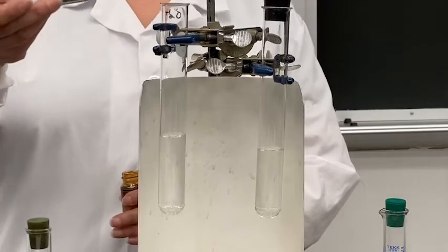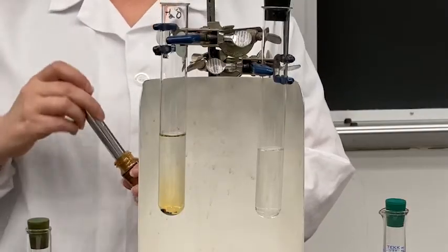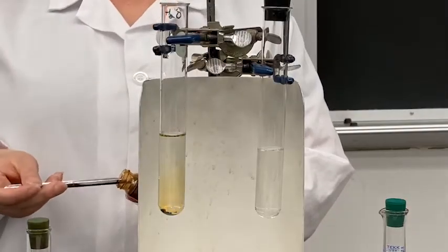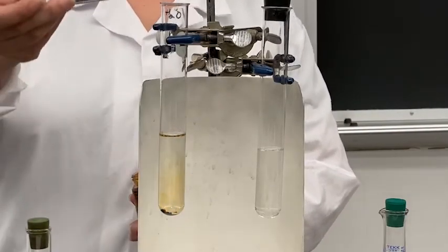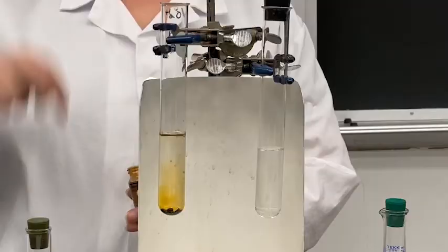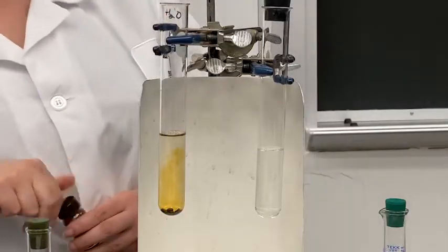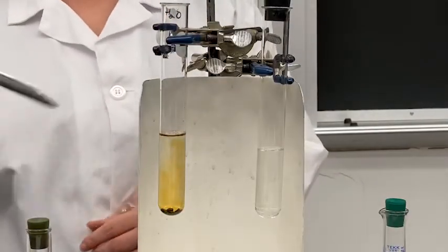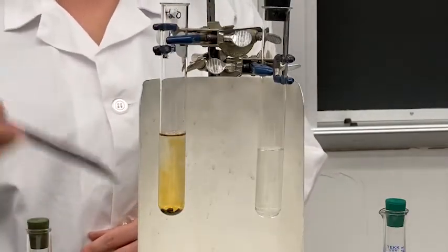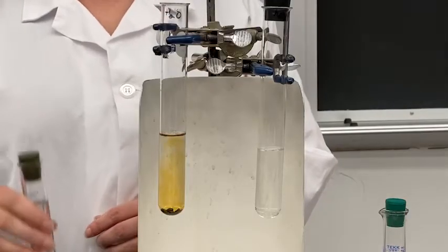It actually sublimes at room temperature. You can see it just hangs out in the bottom — again, that brown color is from the high vapor pressure of iodine.